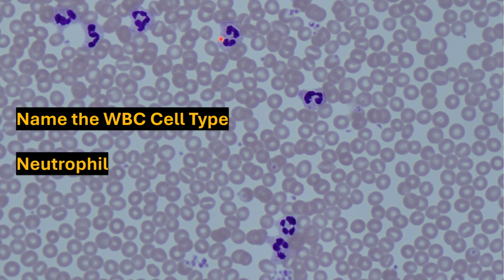Note that they are granulocytes, but the granules can be difficult to see, especially at this magnification. This neutrophil over here appears to be a bit more immature, and that is, its nucleus isn't fully lobulated into 2, and it can be mistaken for a monocyte. I've never asked one of these on a lab question or on an exam, because this can be a bit confusing and a bit of a gray area. But do know that these immature band neutrophils can be observed a bit in peripheral blood, so be careful with those.